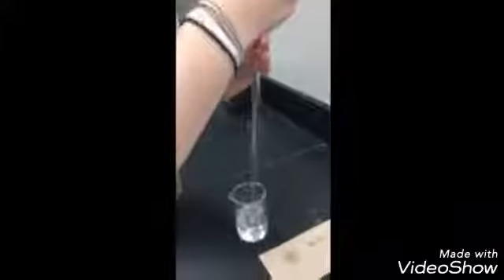For our third dilution, we're going to take 4 milliliters of our stock solution and put it in the volumetric flask. The curve in the surface of the water is called the meniscus. A meniscus forms due to the polarity of water. Glass molecules are also polar. Polar molecules like to stick together. That's why the water in the glass tube is going to stick to the sides of the tube.